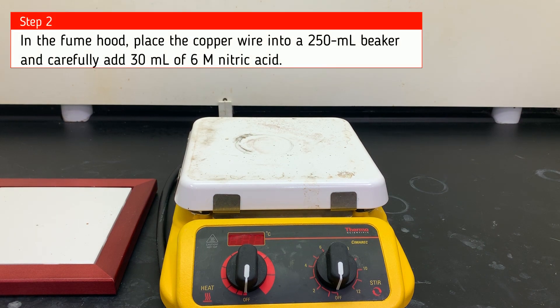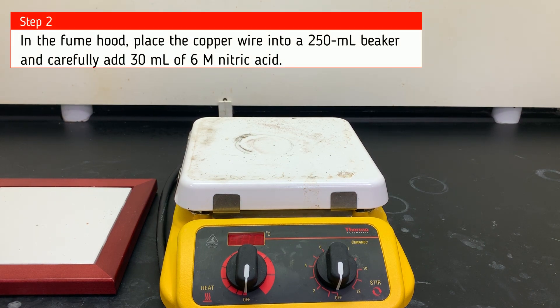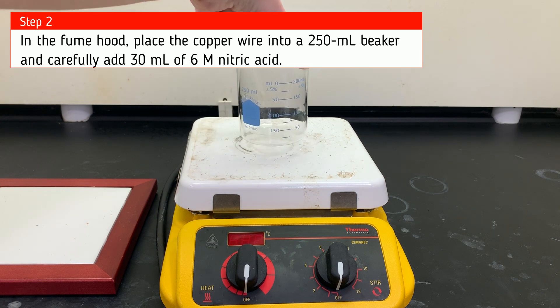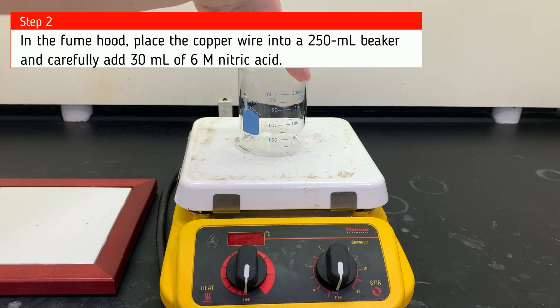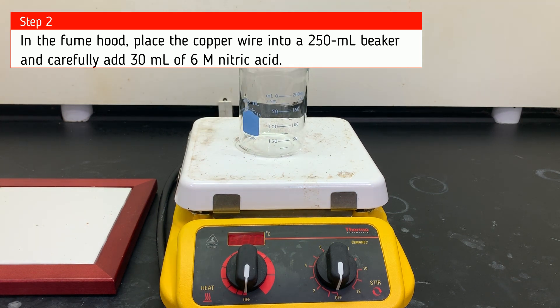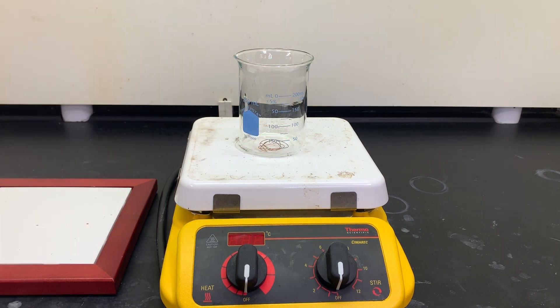Then we will move to the fume hood where we'll place the copper wire into a 250 milliliter beaker and carefully add 30 milliliters of 6 molar nitric acid.